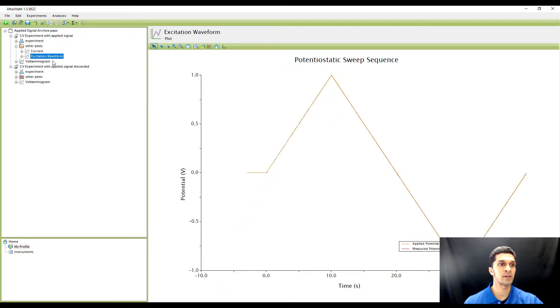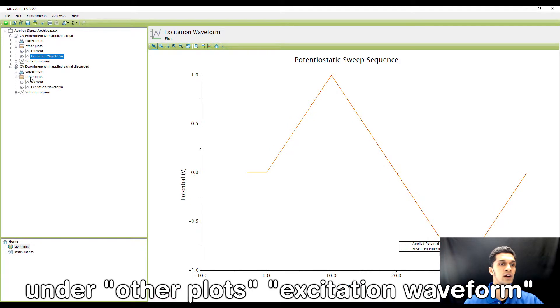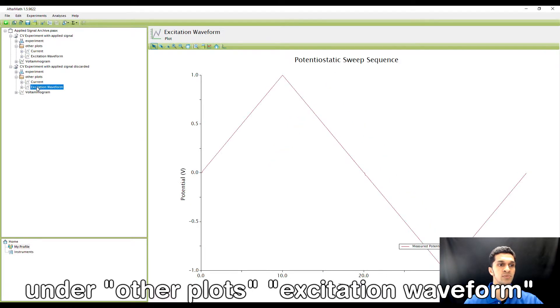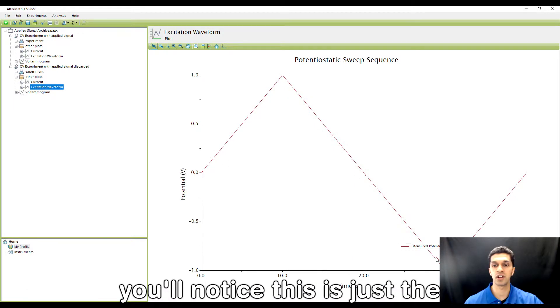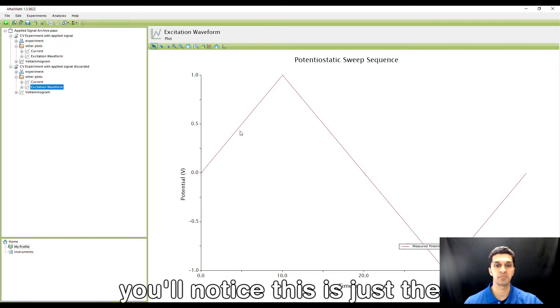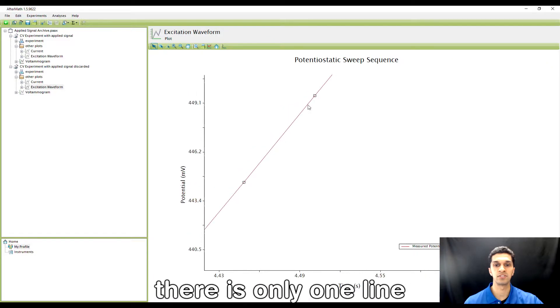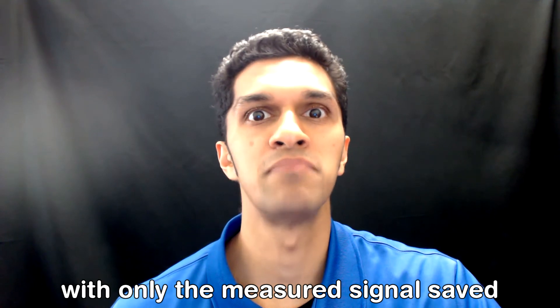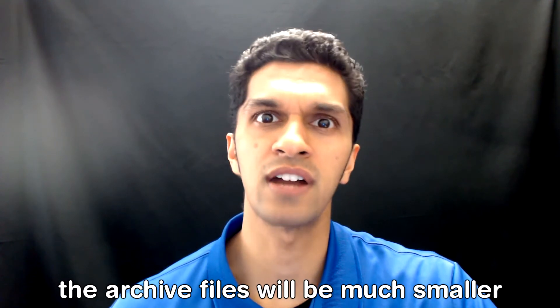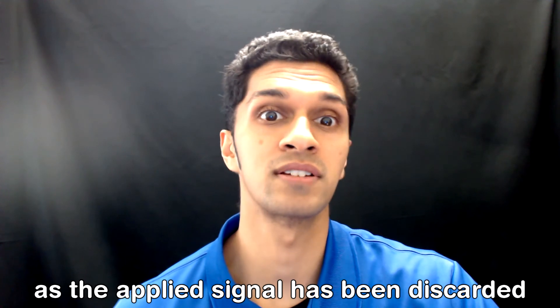Over here I have an experiment where I've already done that, and then under other plots, excitation waveform, you'll notice this is just the measured potential. If I zoom in, there is only one line with only the measured signal saved.